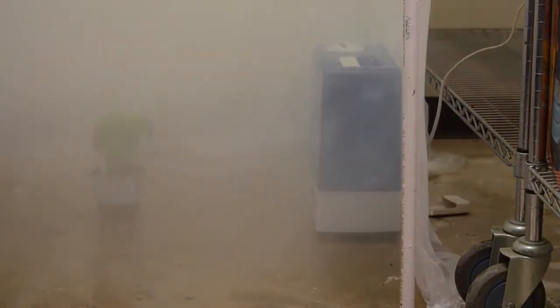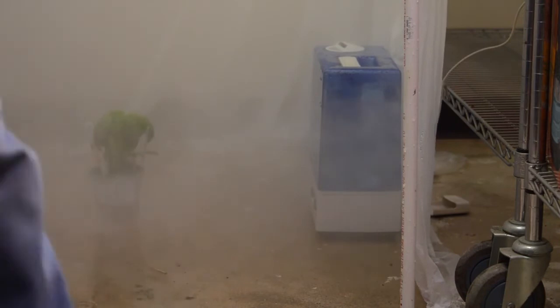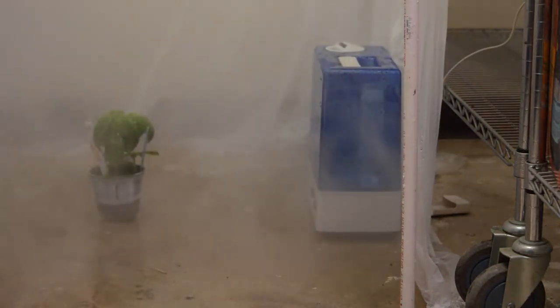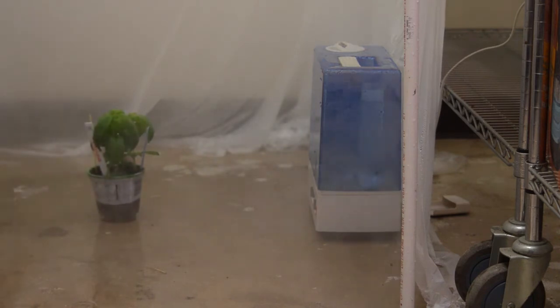The plant is then moved to the humid chamber and left for 24 hours. You can see the amount of moisture, call it fog, that the plant was under for that time. This gives the fungal spores enough time to infect the plant.